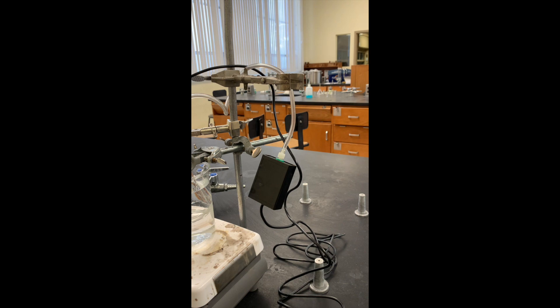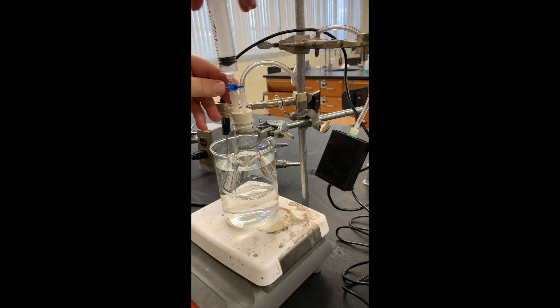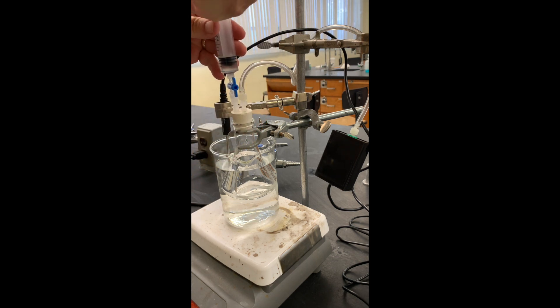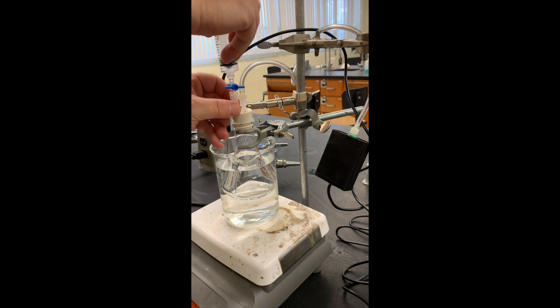This is going to be put on the top of the apparatus. I'm going to close the valve and add the syringe. Open the valve, inject the three milliliters of methyl alcohol, and then pull the syringe back out to the three milliliter mark so we haven't compressed the air in the flask. Now I'll pull the syringe back out to three milliliters and close the valve. The syringe can now be taken off.